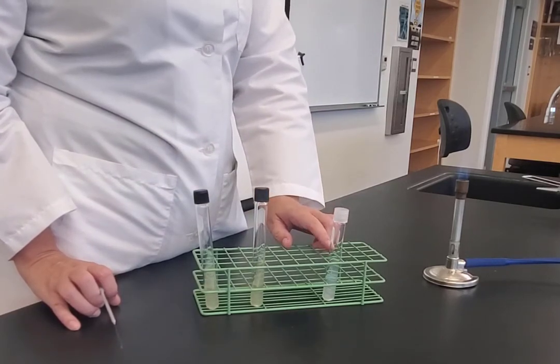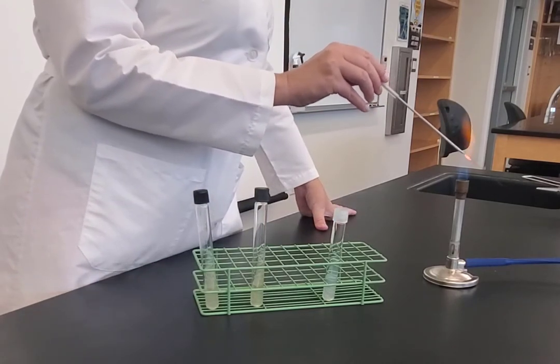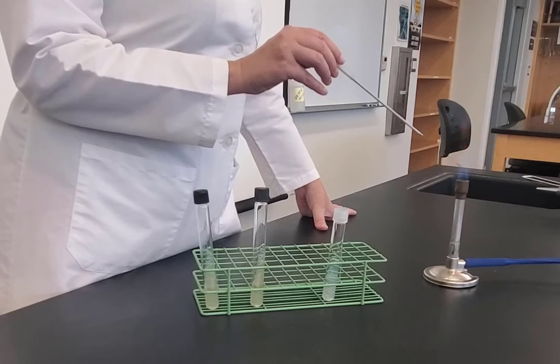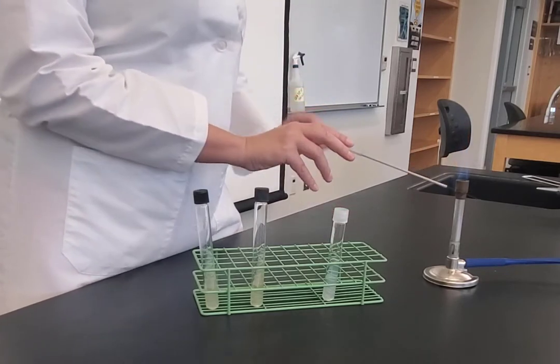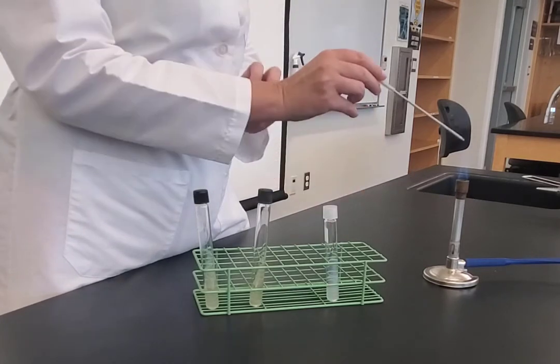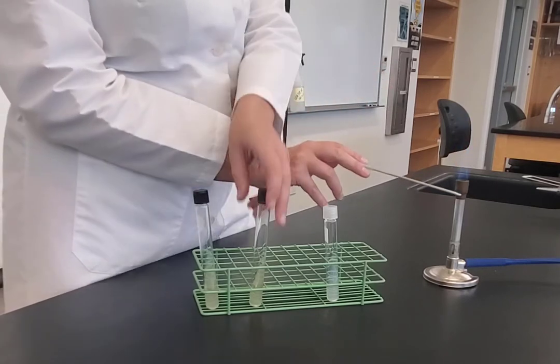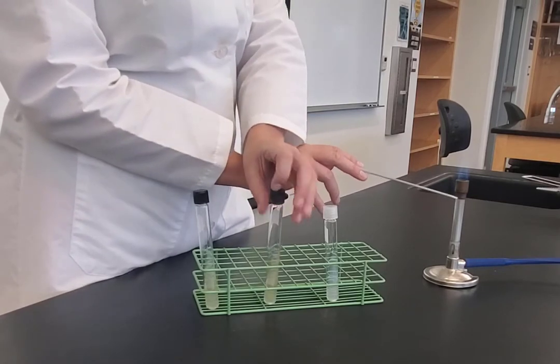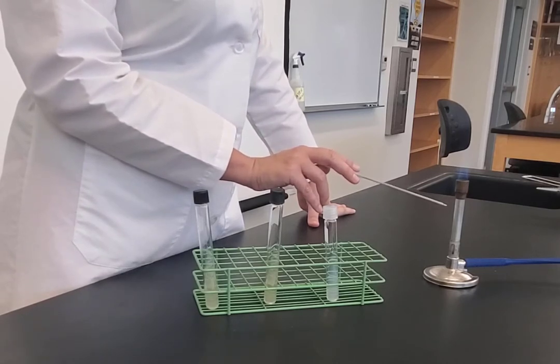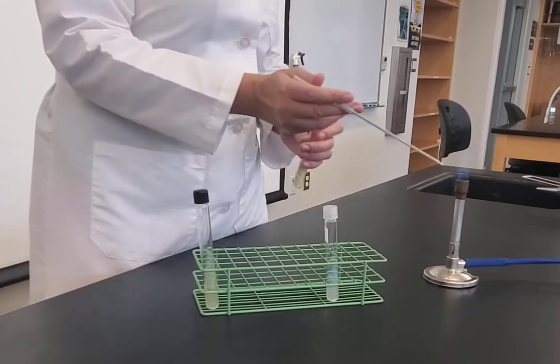I would make sure that my tube is well labeled, then flame my loop. I'm inoculating the slant so it's a zigzag inoculation, and I'm going to let it cool. These are screw tops, so I need to loosen the caps while my loop cools.